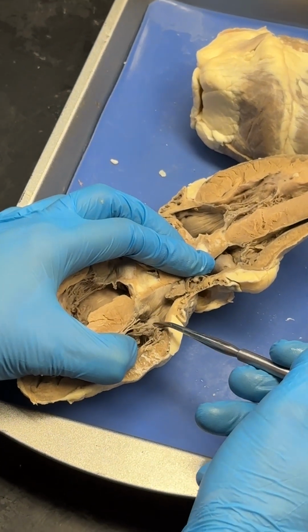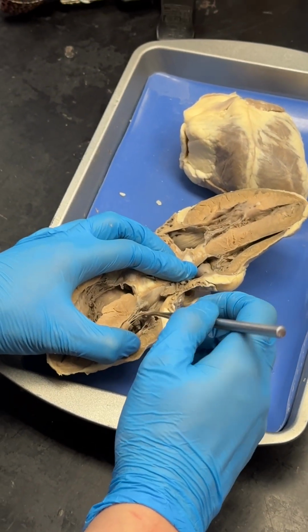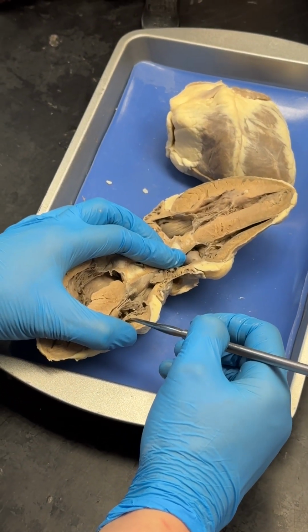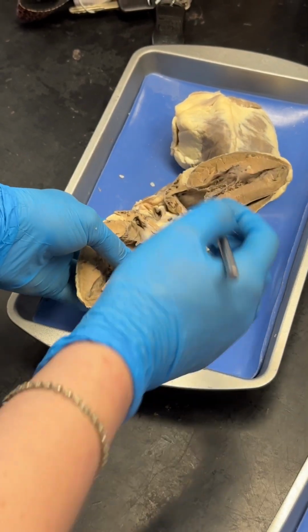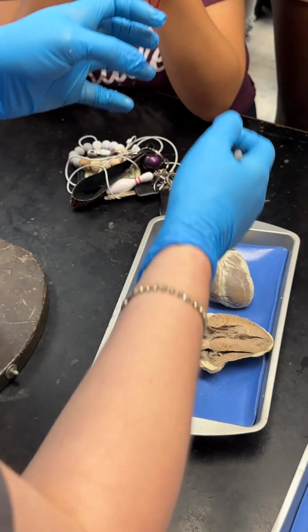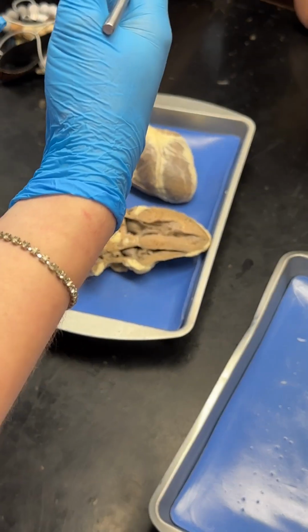On this side, this is called the tricuspid valve, and the chordae tendineae attach that tricuspid valve to, again, papillary muscles. It's called tri versus bicuspid because these are basically little leaflets that make up the valves: two in the case of the bicuspid, and three little leaflets on the tricuspid side.